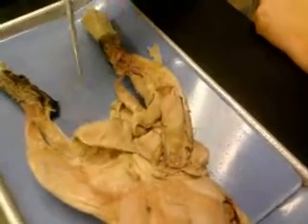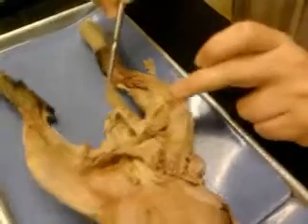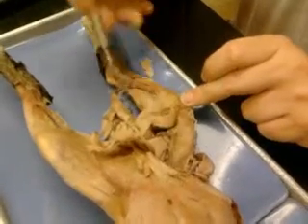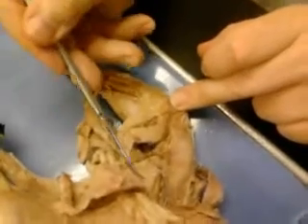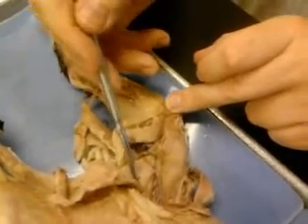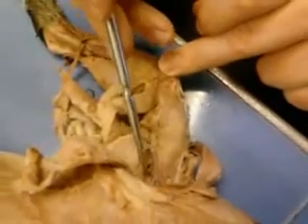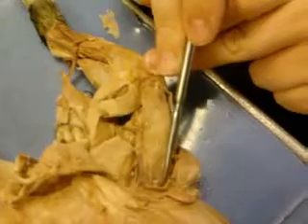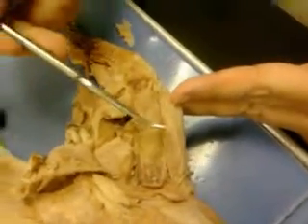The gracilis, the semitendinosus, the semimembranosus, the adductor femoris, the adductor longus, the pectineus, the iliopsoas, the sartorius, the tensor fasciae latae.